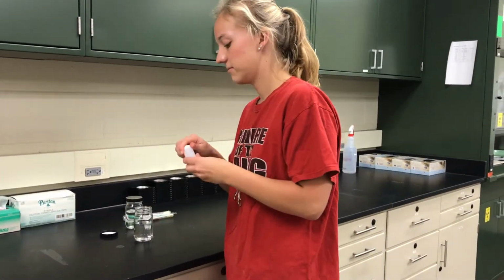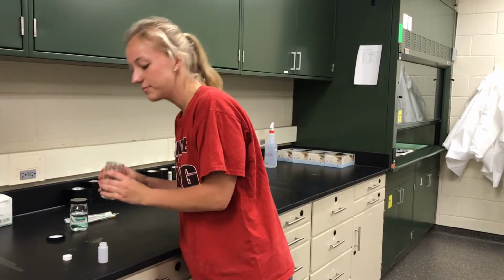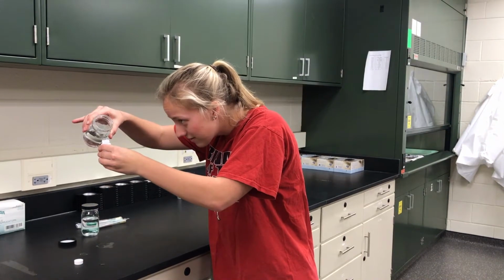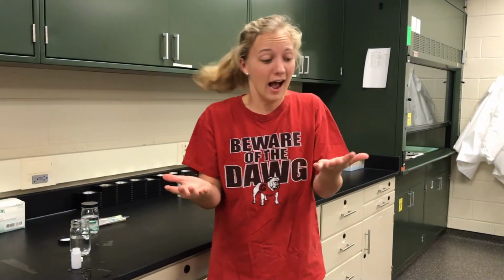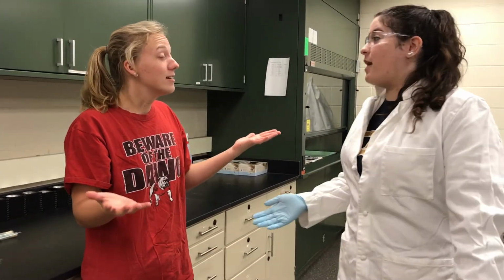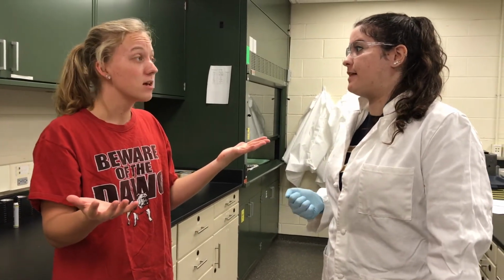Meet UGA's valedictorian, Marianne, here trying to pass chemistry lab for the fourth time. Let's observe her in the lab. Oh no! I spilled it all over me! I don't know what to do! Somebody, help! It's okay. Accidents happen, but it's important to know how to respond during emergencies to lessen disastrous effects.